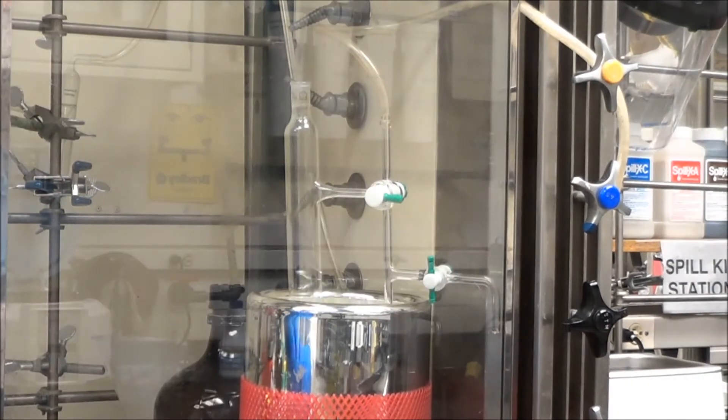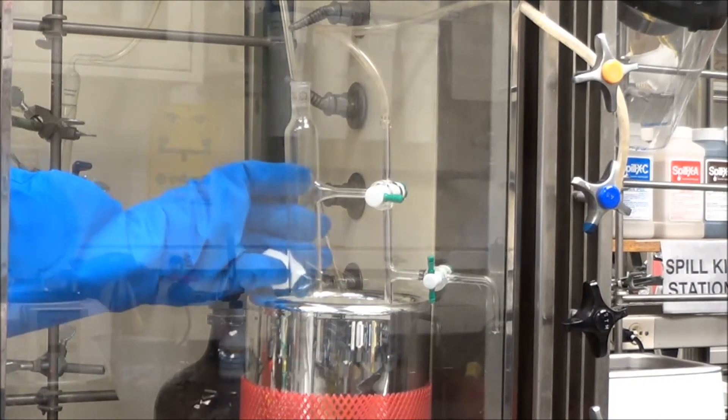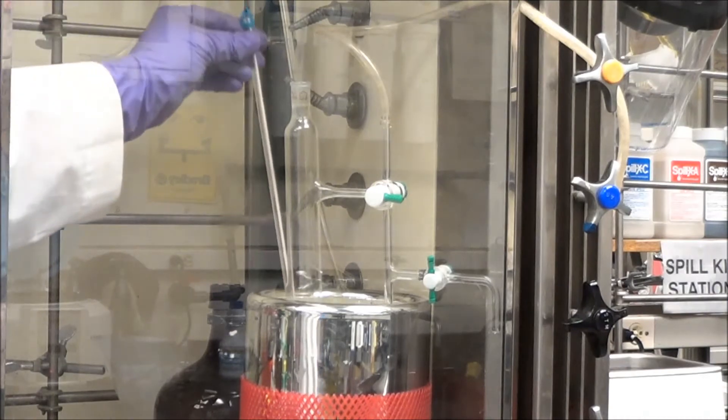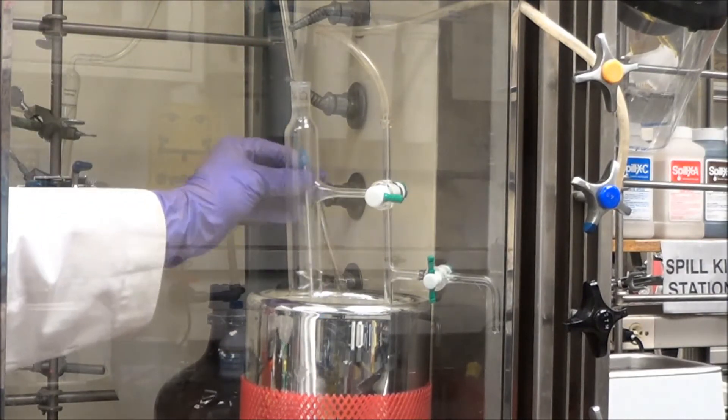So occasionally, I just add a fairly small amount of dry ice. I don't ever need to add too much, maybe once every half hour. Of course, I'm using the correct cryogenic gloves. And I stir the solution while monitoring the temperature.